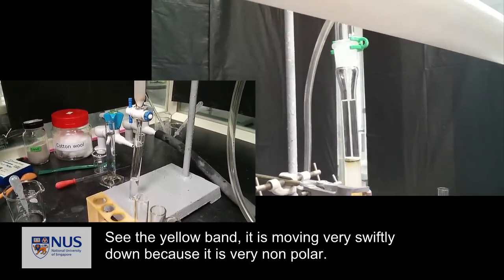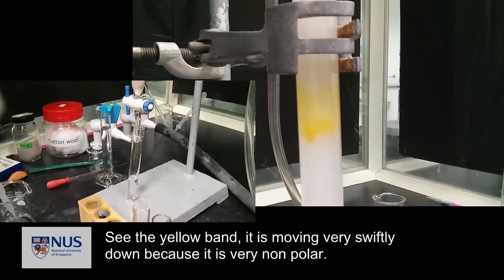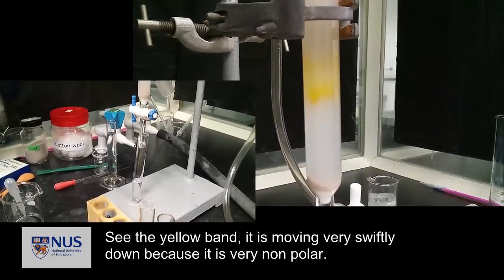See the yellow band. It is moving very swiftly down because it is very non-polar.